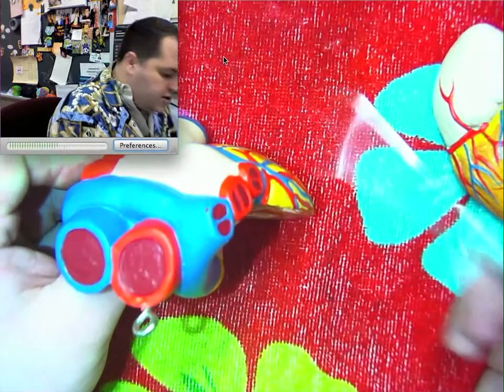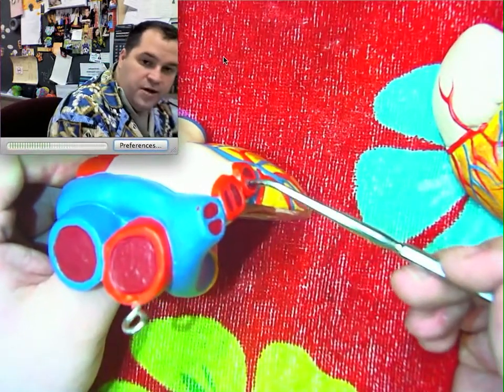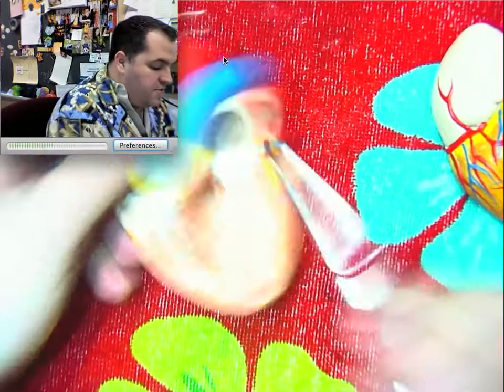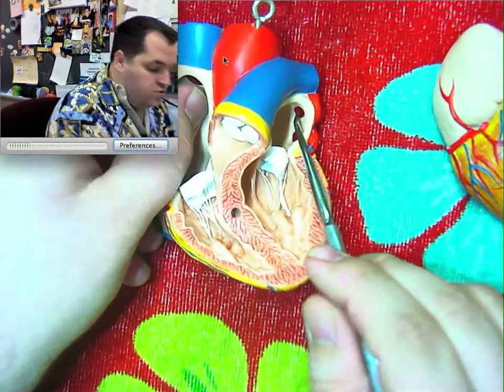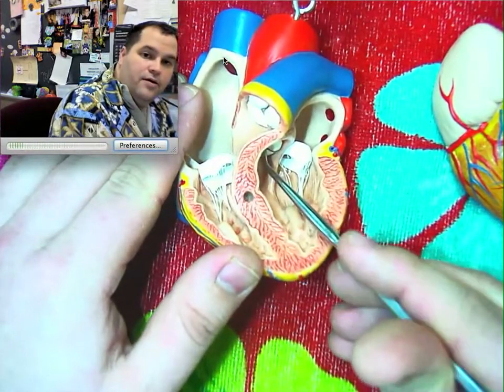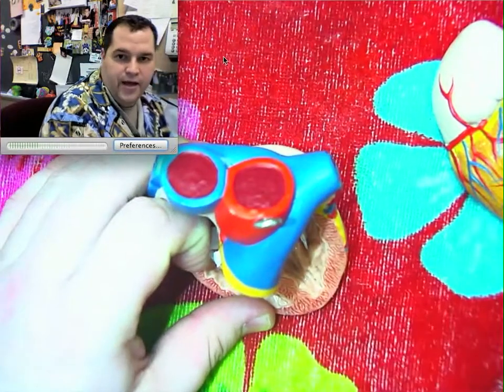All right, and then if we take a look at the dorsal side of the heart, kind of dorsolateral, we have the red structures of the pulmonary veins. Yes, they're veins, and yes, they're red because they do have oxygen rich blood, and they're coming back, of course, to the left atrium, then to the left ventricle, and then up the aorta here to the rest of the body. And there we go.